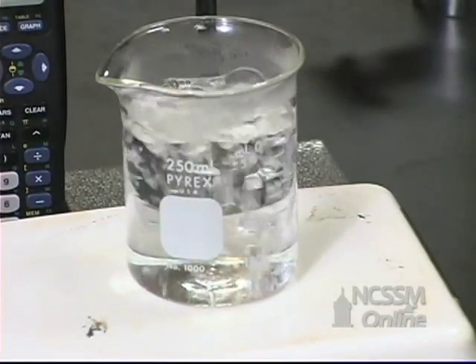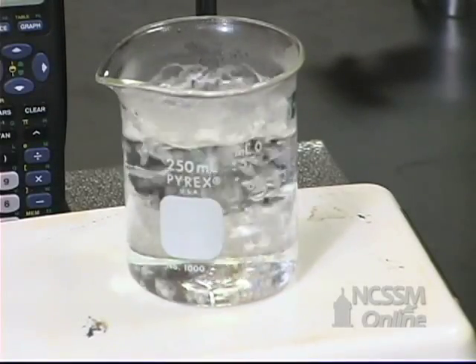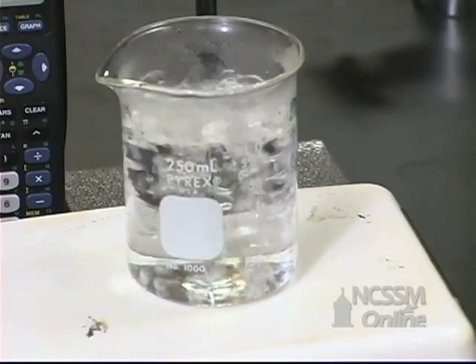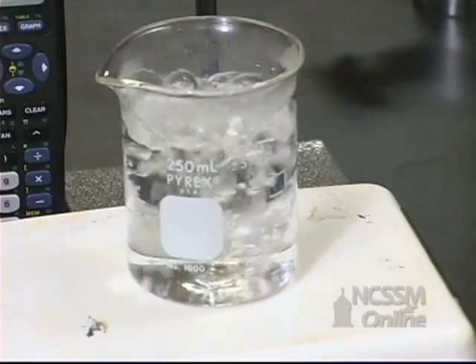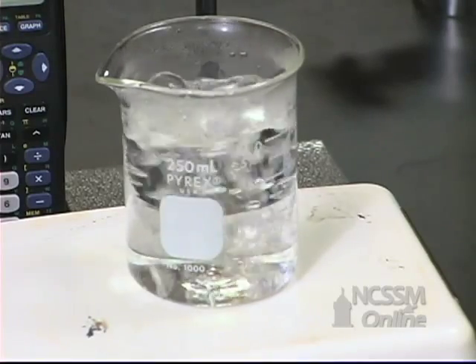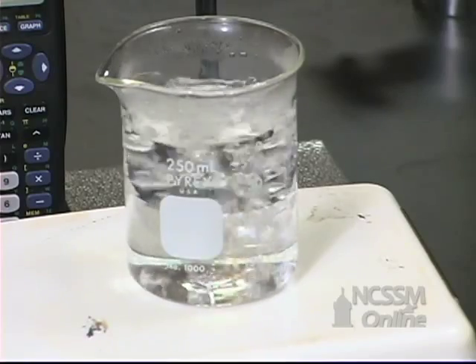We're going to measure the freezing point depression of a solution of a compound in lauric acid. In order to measure the freezing point, we're going to calibrate a temperature probe. It will be a two-point calibration.